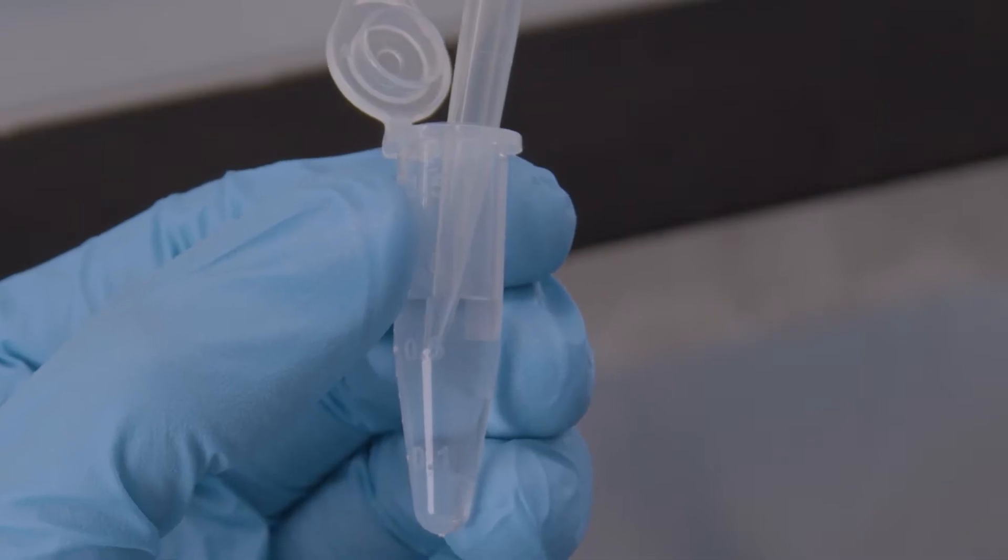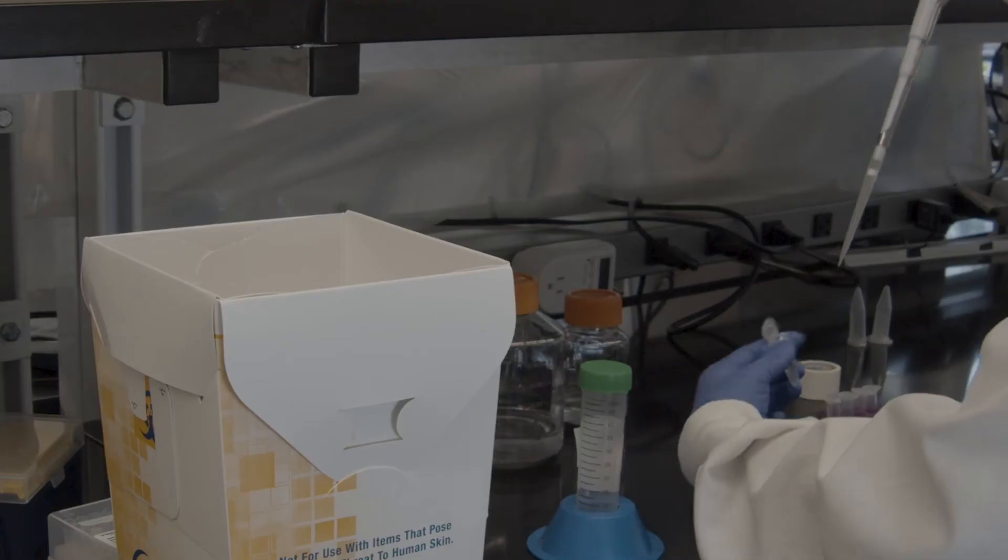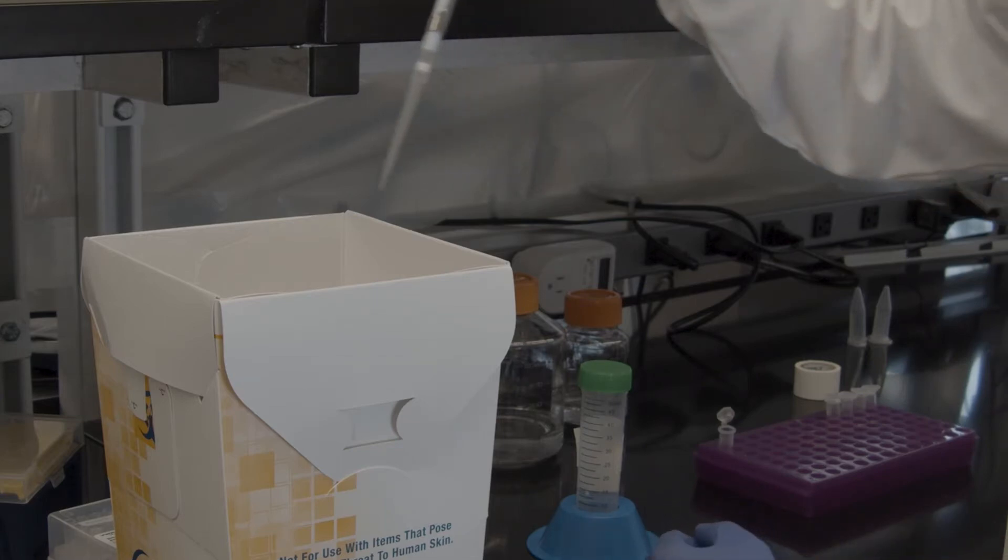This video will teach you proper pipetting technique and how to select the proper pipette and tip for the job. So, let's get into it.